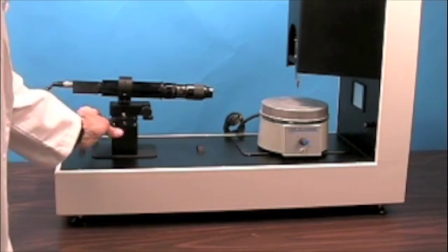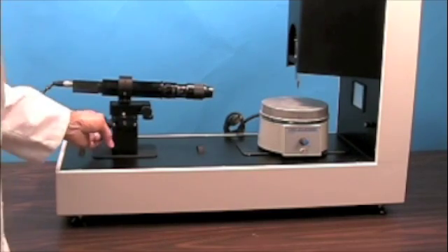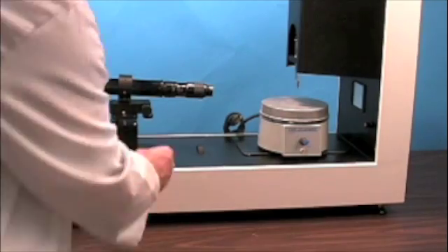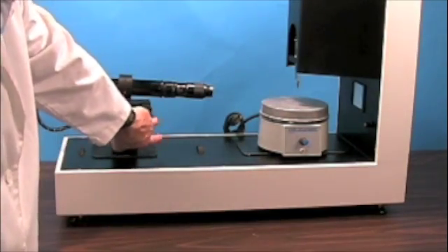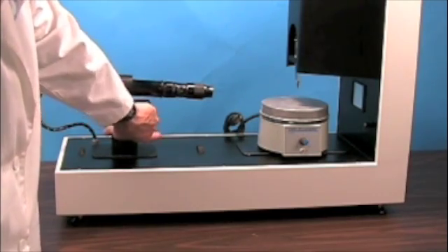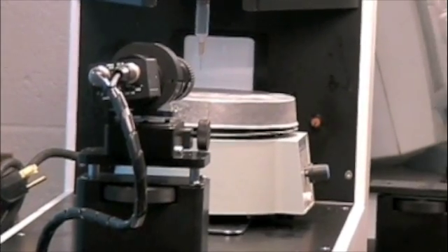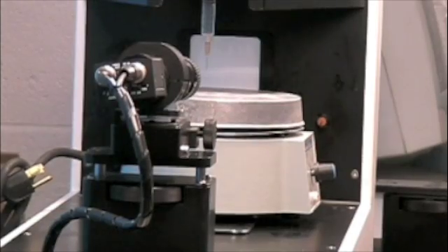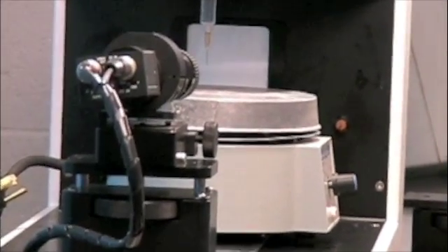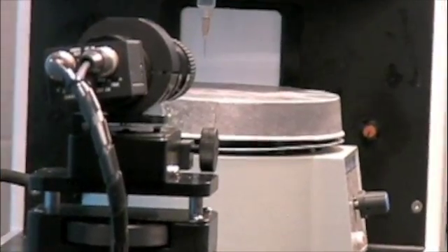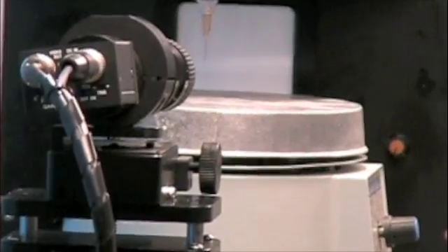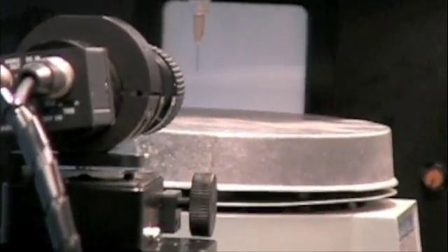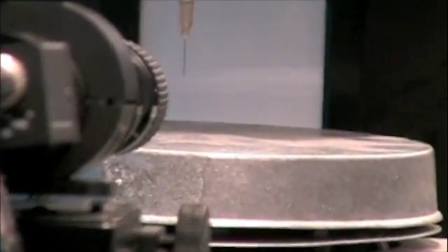We can also move the camera up and down, and we can tilt the camera as well.